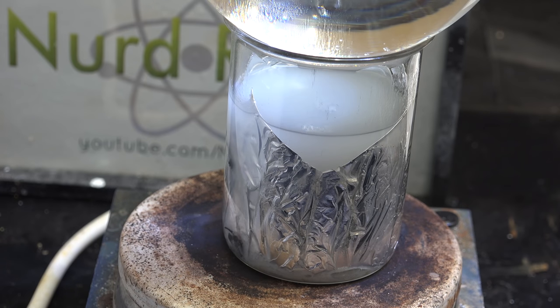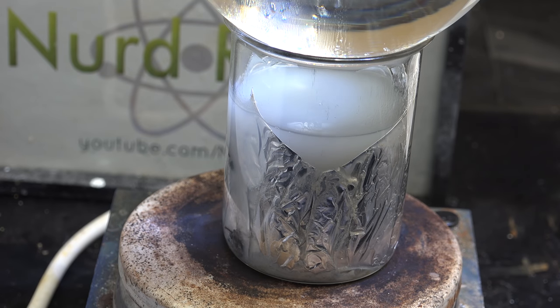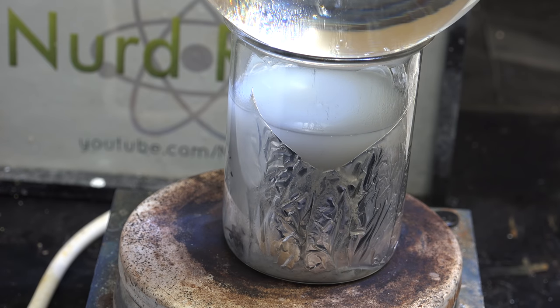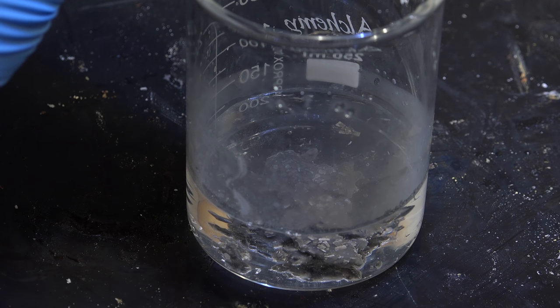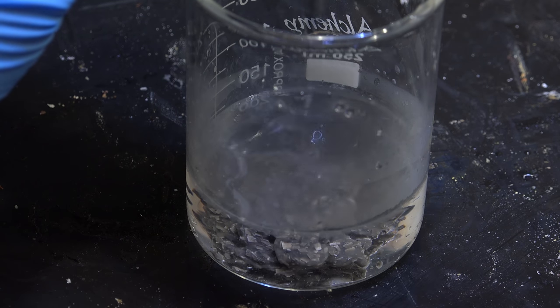To be certain I ran it a couple more times and also tried doing it with aluminum foil lining to reduce damage to the beaker in a separate line of inquiry. It all failed, producing this thick goo of aluminum and magnesium oxides. So for now I'm going to abandon beakers.